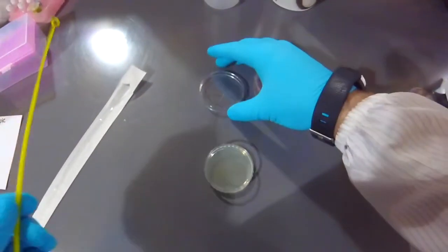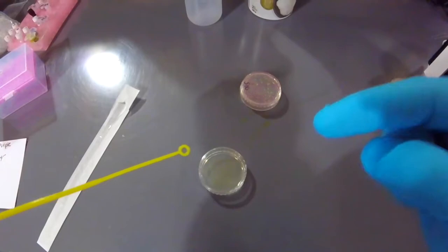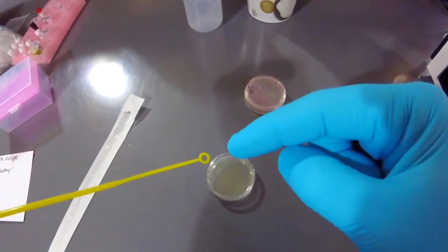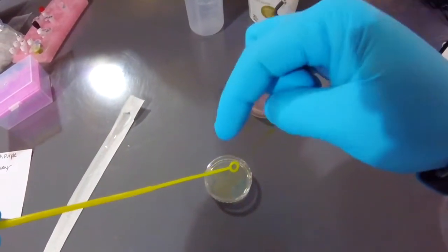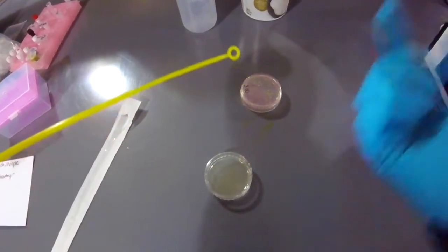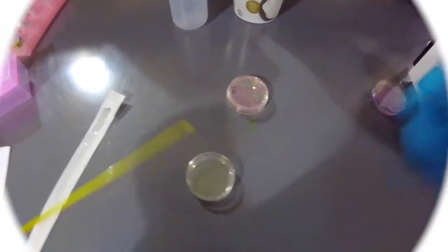So, that's it. If you've got a single loop, you can try and do the super streak method. Again, the tip you can use as the very first streak, and then the sides are still clean. You use one side, and then you can use the other side for the second and third streaks. Thank you.